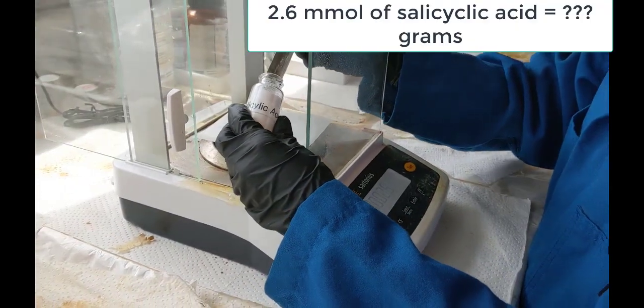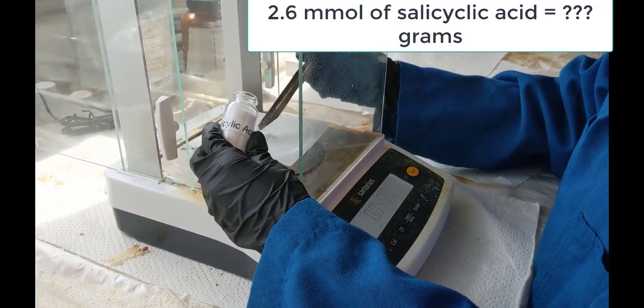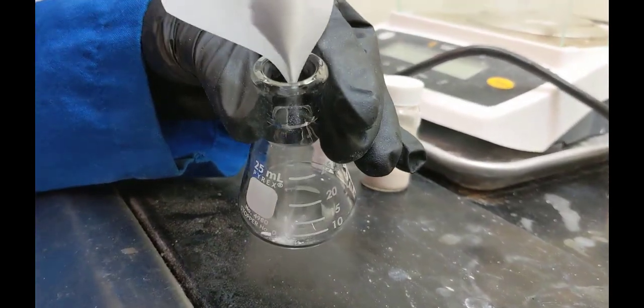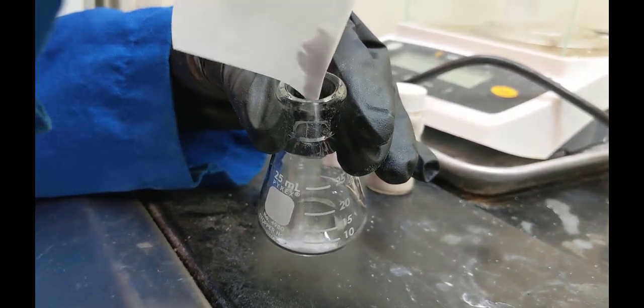And while they're letting that cool to see precipitates, they're weighing out an appropriate mass to give them 2.6 millimoles of salicylic acid. So this is going to be on you to determine what that mass should be. All right, so they're adding that mass of salicylic acid to an Erlenmeyer flask.